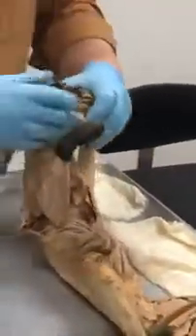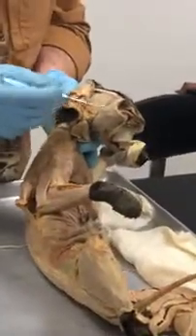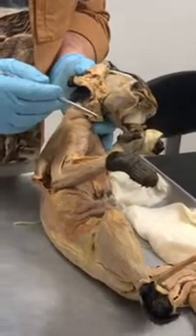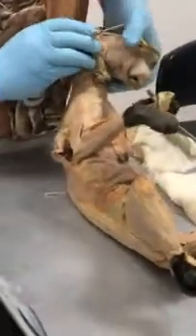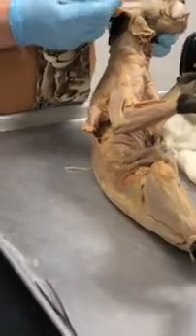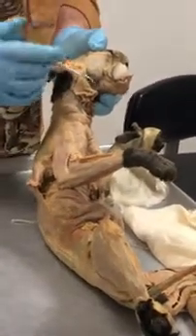Then we have to venture off into the skull area. We have one muscle that's going to be found on top of the temporal bone, called the what? Temporalis, right? Makes sense. Then you have another one that's on the cheek. It's not the buccinator, because this is much thicker and has a different action. What is this here? Masseter, for mastication, kind of makes sense.